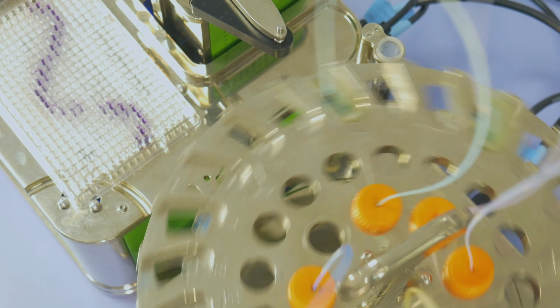Unzip the folder, and you'll have two files, a dispense list and a plate definition file. The dispense list is a list of the liquids that the Mantis will dispense, as well as the end volume and location of those liquids. Drag the dispense list to the Mantis folder called Dispense Lists.